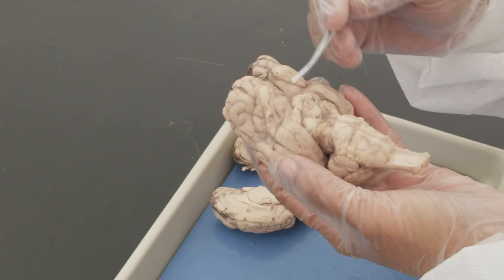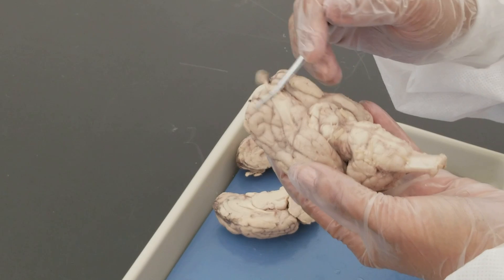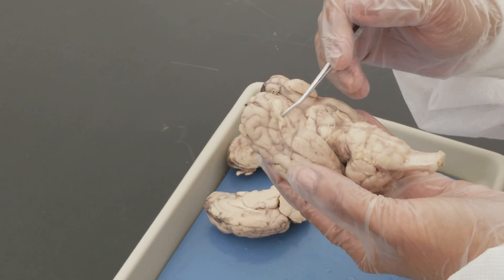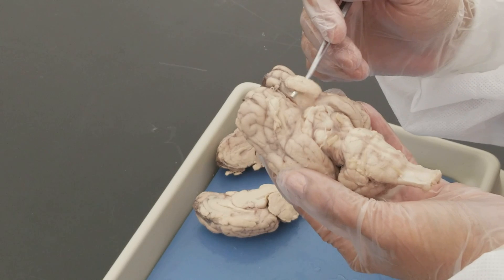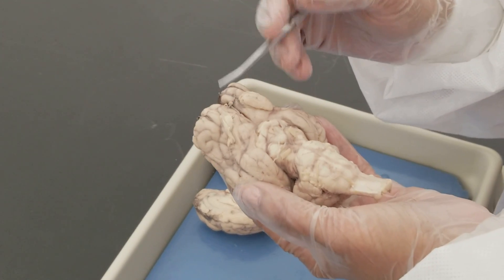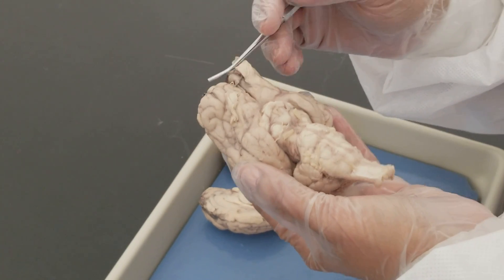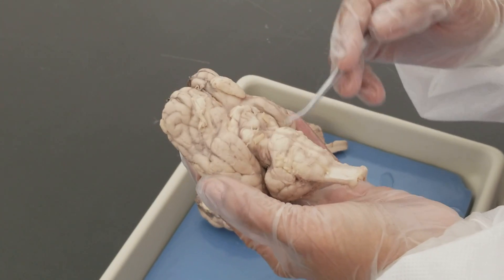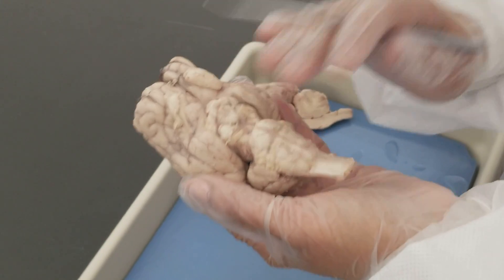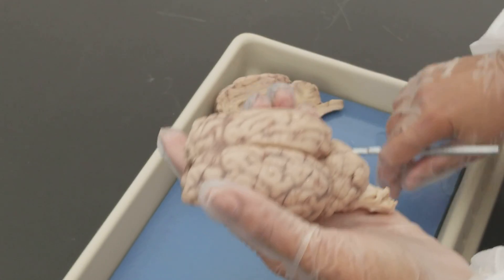Moving more anteriorly are the olfactory bulbs. Olfaction is your sense of smell. This is also a difference between sheep and humans — sheep have bigger olfactory bulbs because their sense of smell is more developed. These are all the structures you can see in the sheep brain inferior view without dissecting it. We've already covered the structures in the superior view.